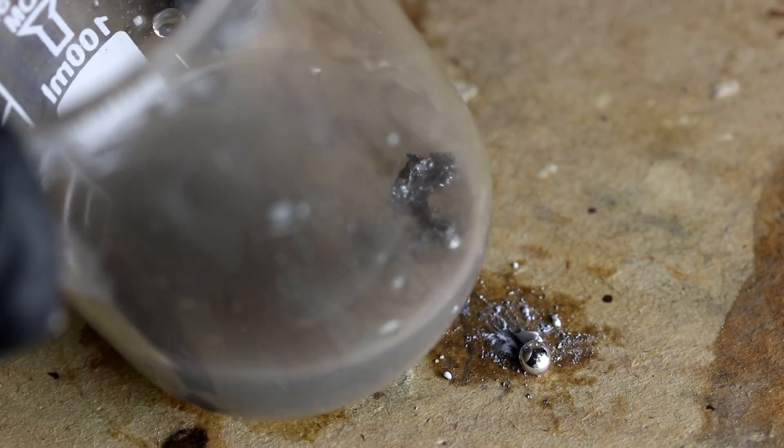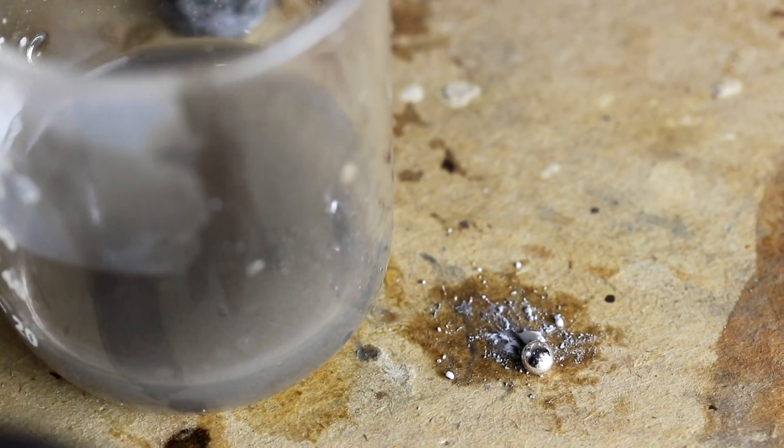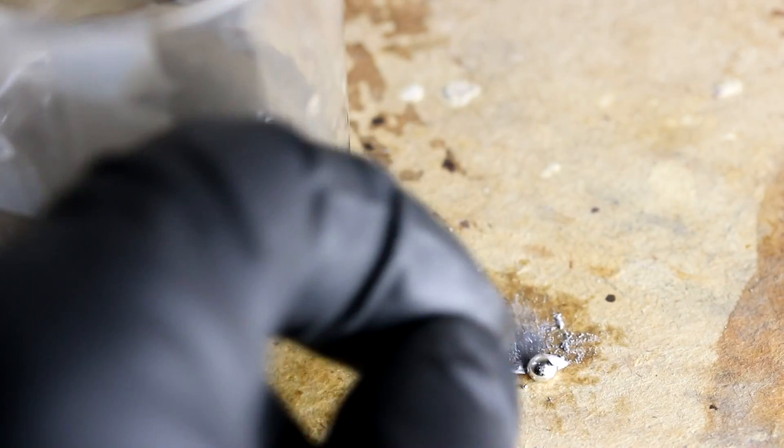Leaving behind some gallium metal there. Let's try some of this that didn't freeze. That did not react.